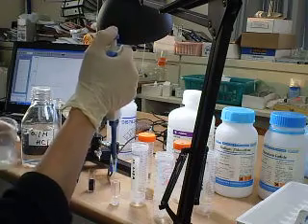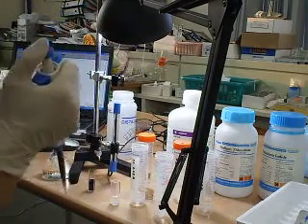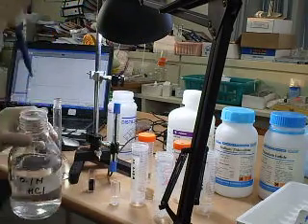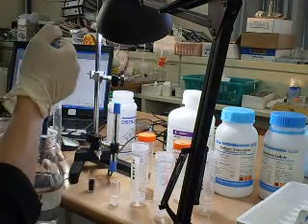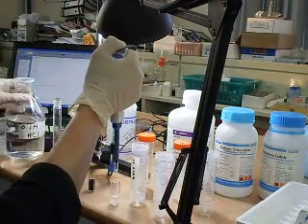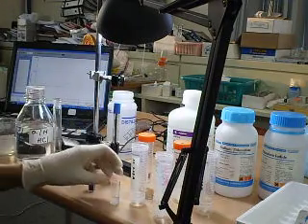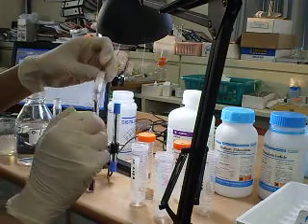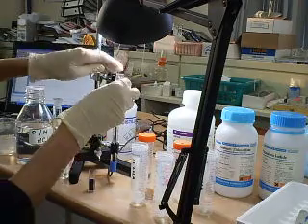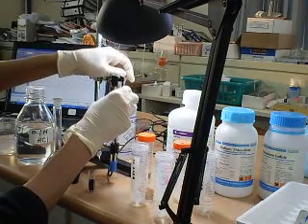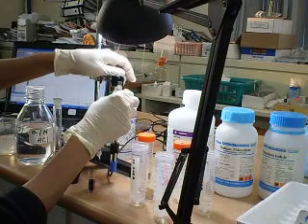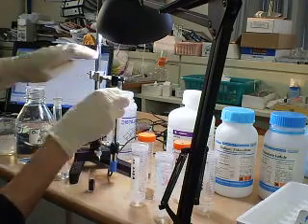100 microliters of acid catalyst. Mix the solution well inside this cuvette, place the cuvette above the light sensor and mix.